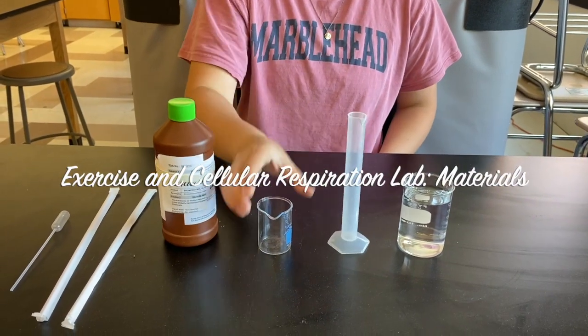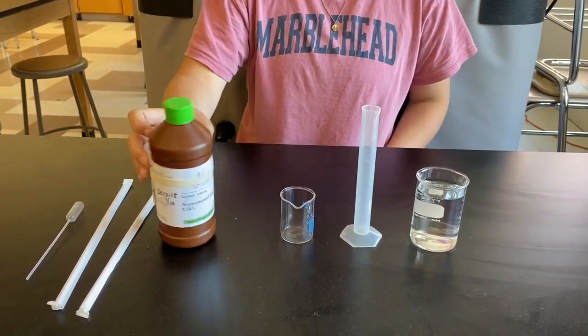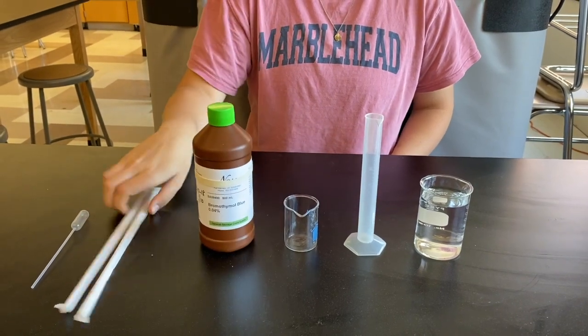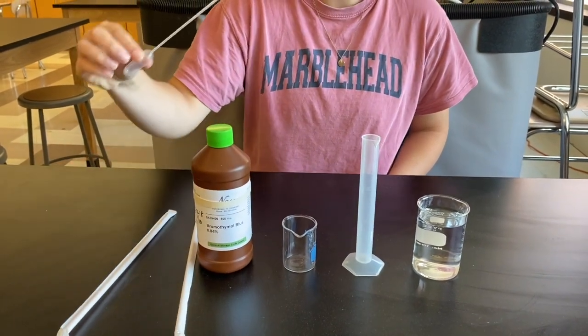Water, graduated cylinder, small beaker, bromothymol blue solution, straws, and a pipette.